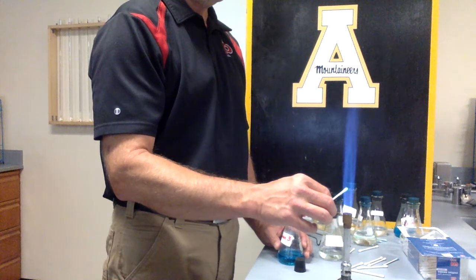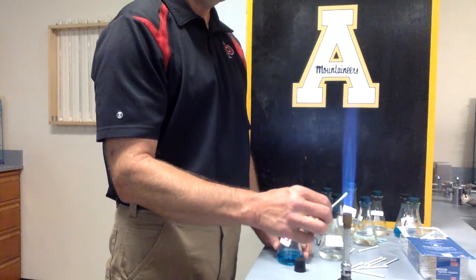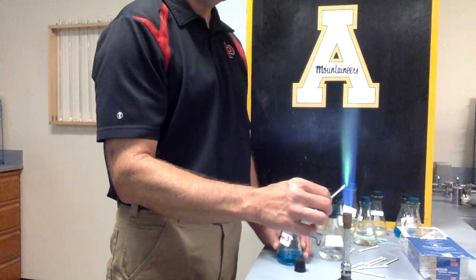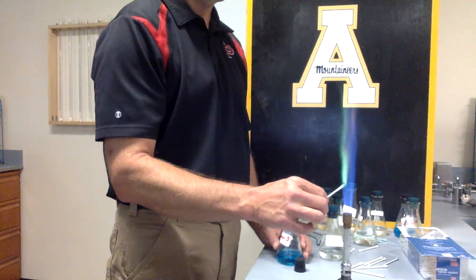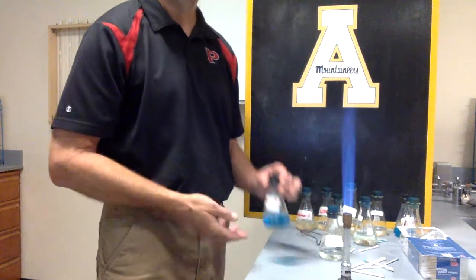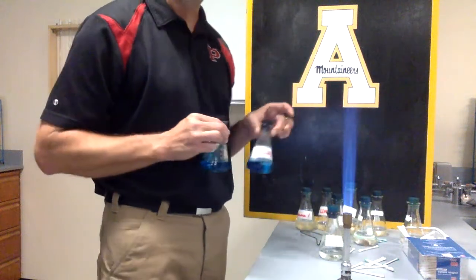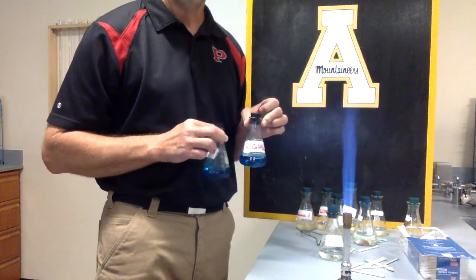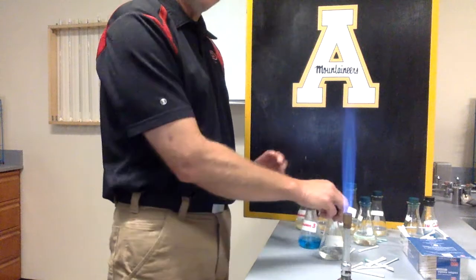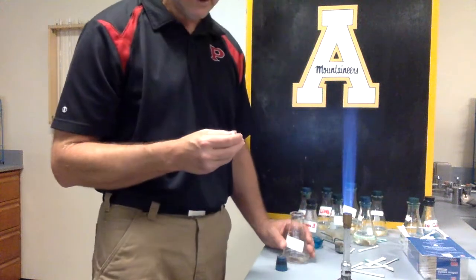All right. Here it comes. There it comes. Nice. Now you can see that it's got that nice green color to it. But guys, sometimes you don't even have to have the color bands because, look, the solution itself is colored. We did have a colored solution over here, and it was our copper nitrate. So I would assume that the ion that's in this solution is a copper ion as well. And that's unknown. Oh, I'm sorry, I went out of order. That was unknown 3. Sorry about that, guys.